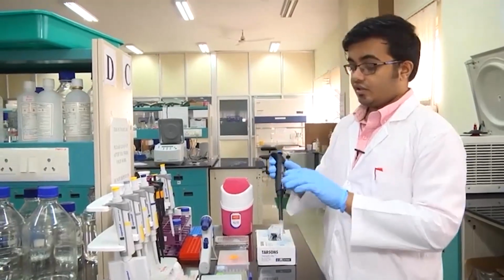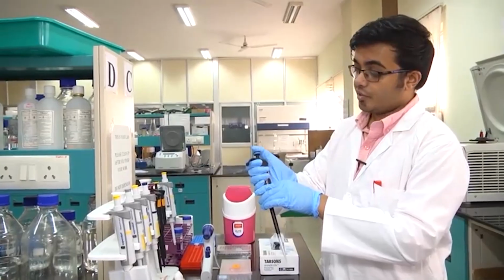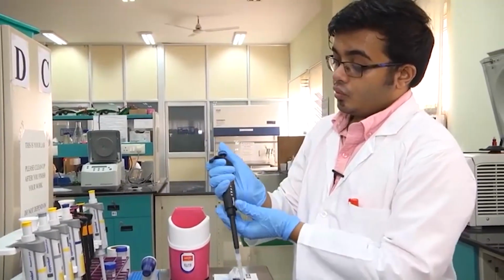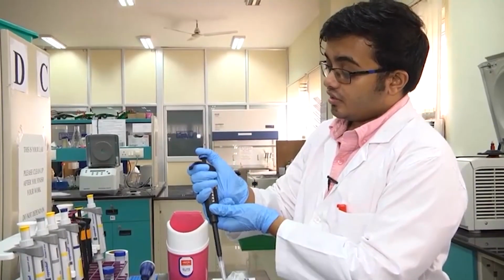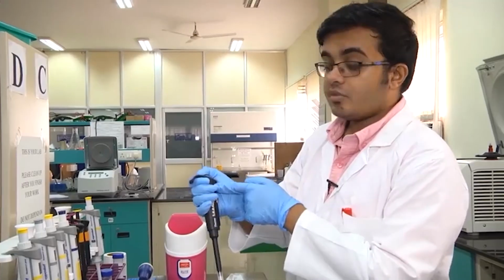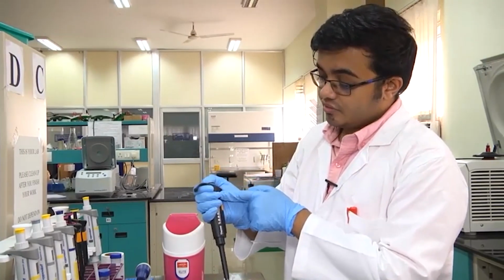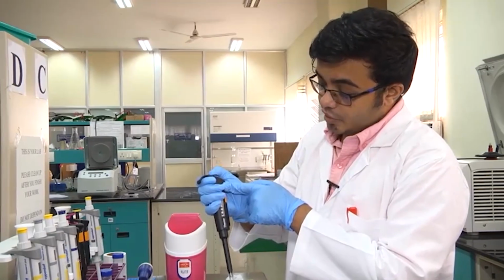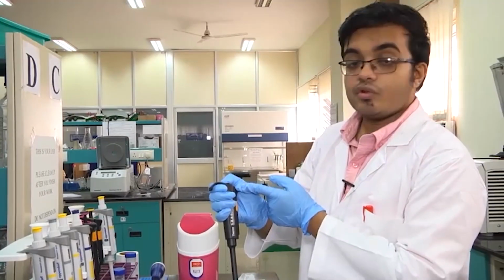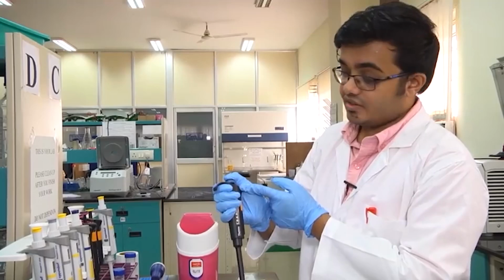Another thing that you need to know is this piston can go up and down depending on the pressure that I exert with my thumb. When you are using a pipette, you will notice that as you keep exerting pressure, the piston keeps on going down until it meets an initial resistance, which we call the first stop. Once it has reached there, you can exert a bit more force and go down until it reaches a second resistance, which we call the second stop. This is useful when we are dispensing liquids.